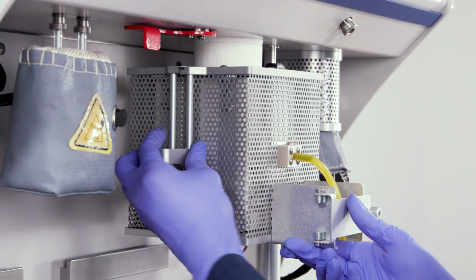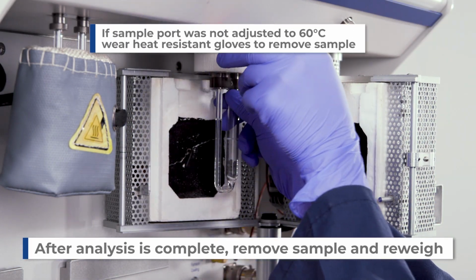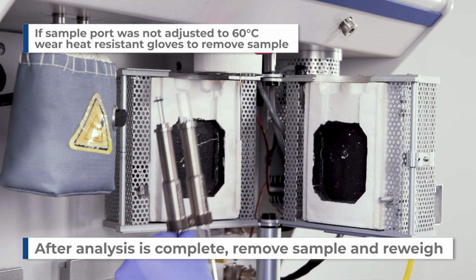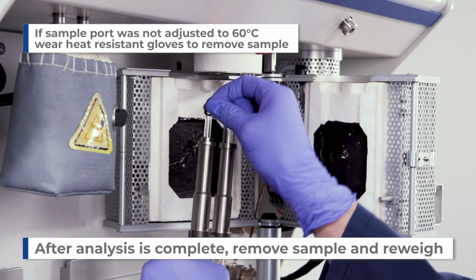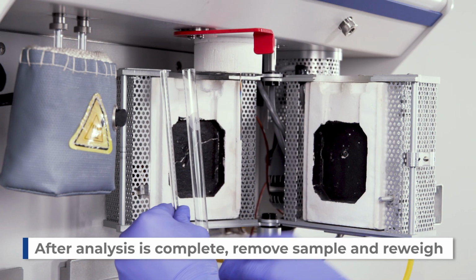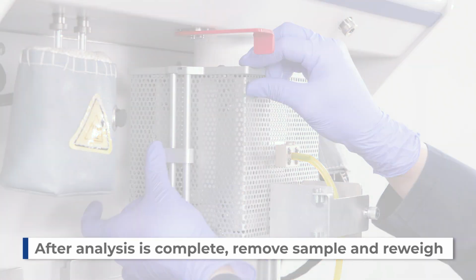After the analysis is completed, open the furnace, turn to disengage the Quick Connect, remove the sample tube, O-rings, and sample collar, then reweigh the sample. If the sample port was not adjusted to 60 degrees Celsius, ensure to wear a pair of heat-resistant gloves and remove the sample tube with caution.